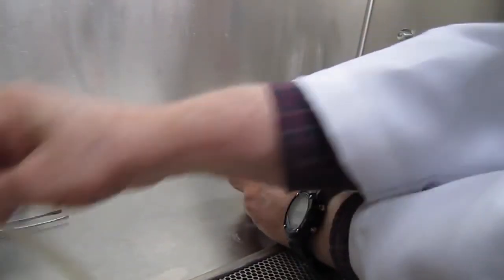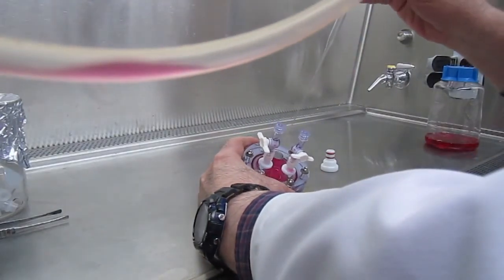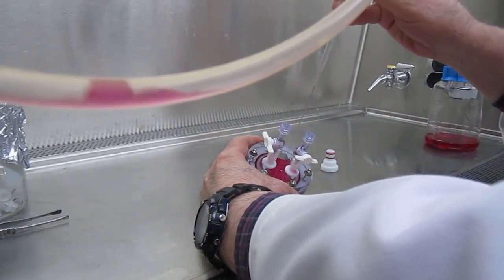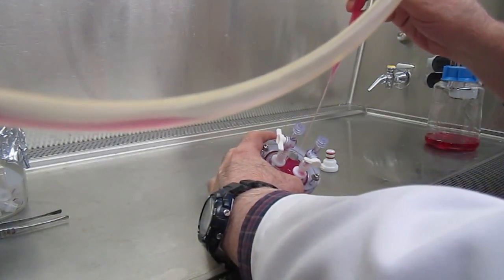And then aspirate approximately three quarters of the media, being careful not to disturb the cells at the bottom.